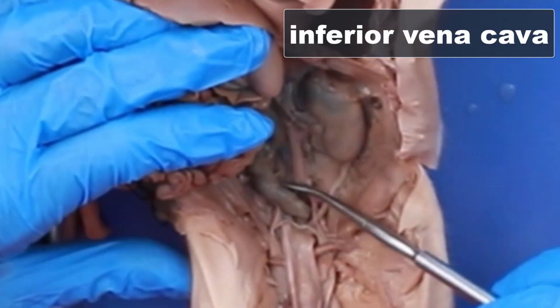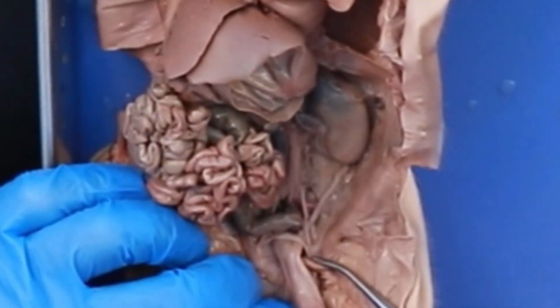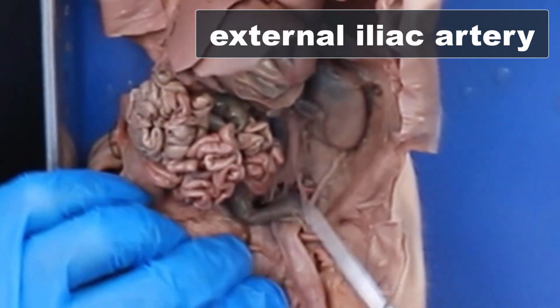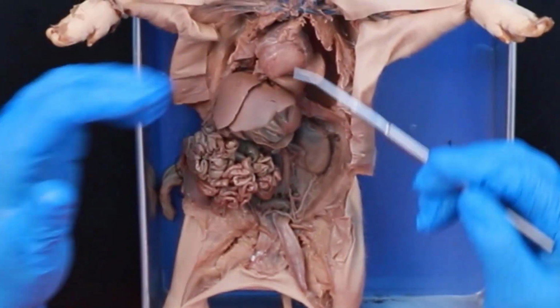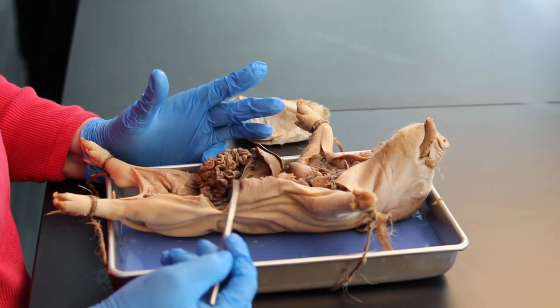There is your inferior vena cava. And if you look here, it's beginning to split. This is your external iliac artery, which then goes down into the legs and becomes the femorals. So you can see that entire track all the way through the pig, and you're able to trace these.